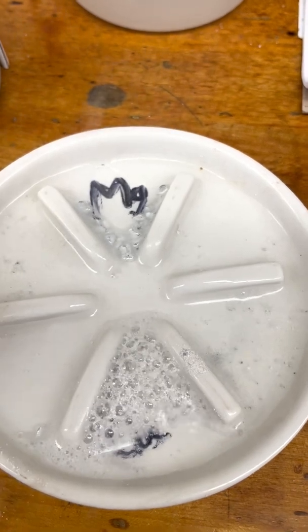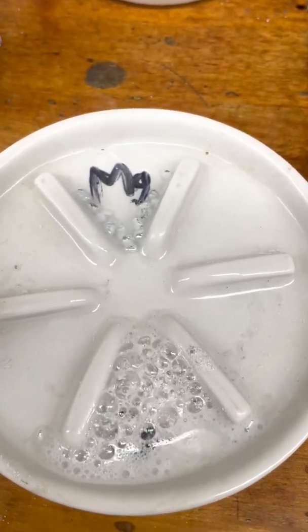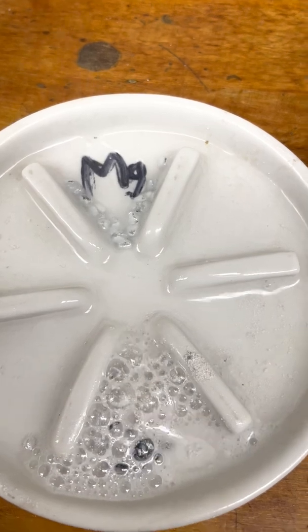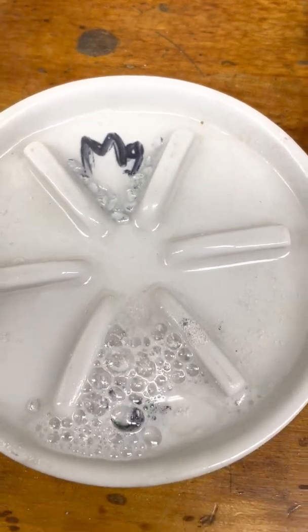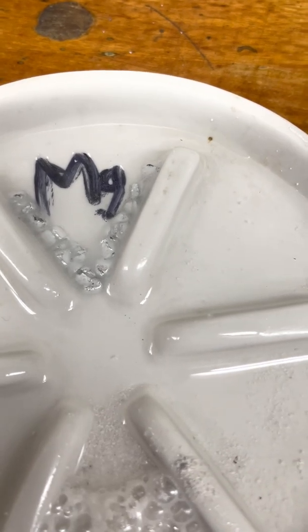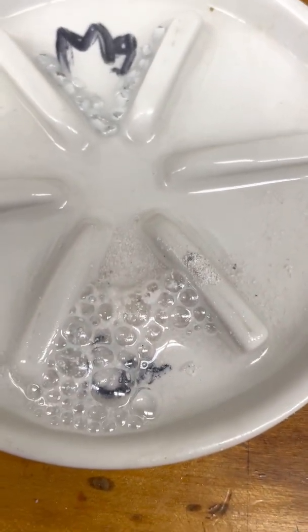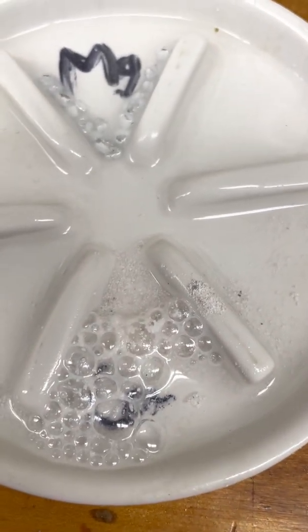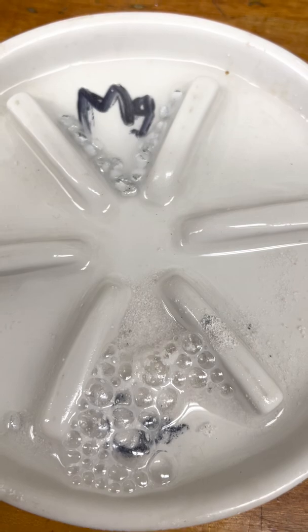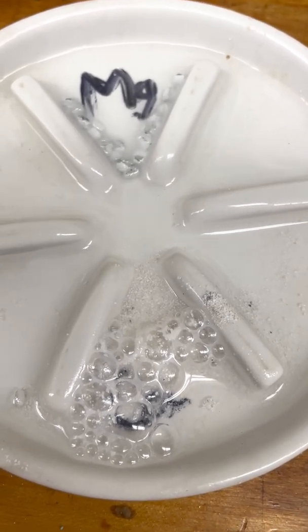You can see that they are both reacting in a similar way, but not exactly the same. The magnesium is reacting — you can see bubbles of hydrogen being released. And calcium also is creating those bubbles of hydrogen. So they're reacting in a similar way, but with different intensity.